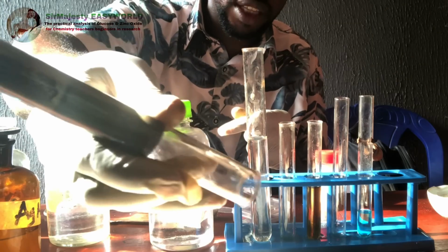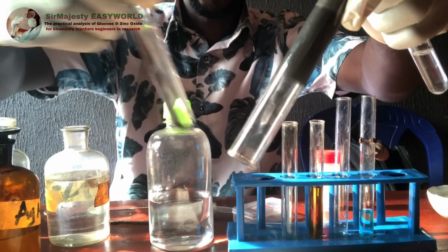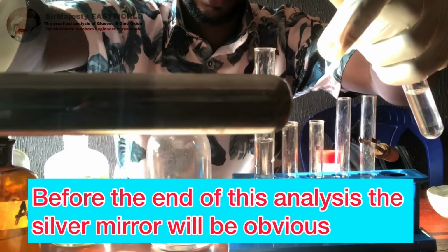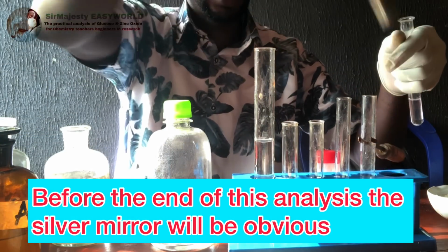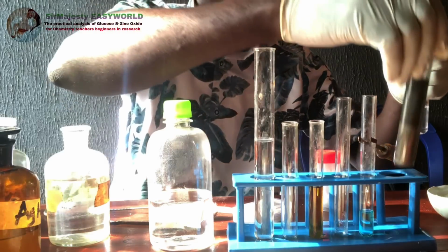See, I've inverted this, so it means there will be a coating of the inside of this test tube with silver metal, due to the reducing sugar. You see, it is not becoming very clear again, it's becoming cloudy, and eventually there will be a deposit of silver by the reducing sugar. So that's what we call a silver mirror, because there will be a silver mirror coating the inside of the test tube.